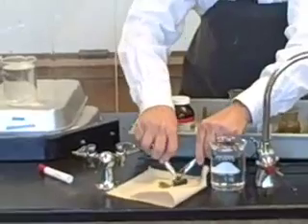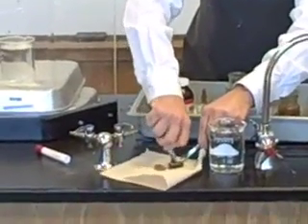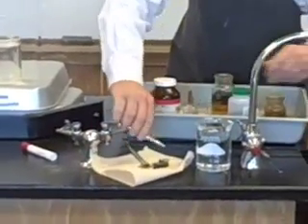This isn't going to blow up like it did in Mr. Voss's class, will it? Hope not. That was so tight. Oh god, that was tight. But I've got my goggles on just in case.